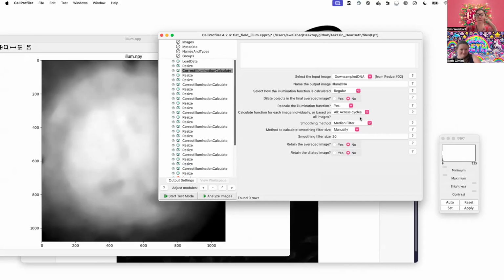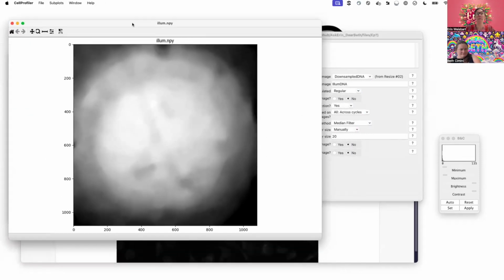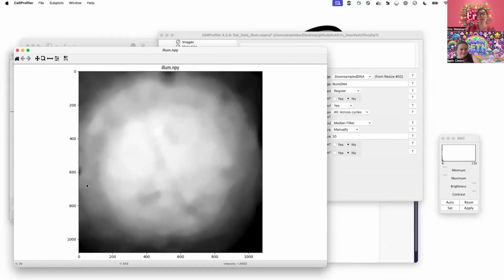Then here, these smoothing methods, filters, and size, this is a great place to start. Even beyond setting it manually, you can set it automatically. But this is something you can check empirically. Basically, you want to get out something that looks like this, or a little bit smoother, or a little bit bumpier. But if there's too much structure, you can start to create artifacts, just by the level of structure in here.